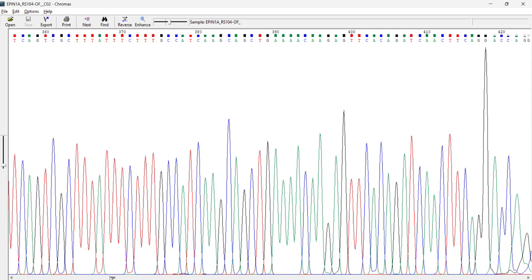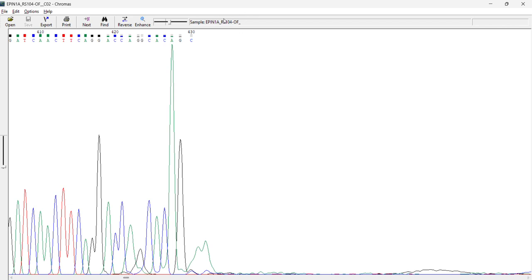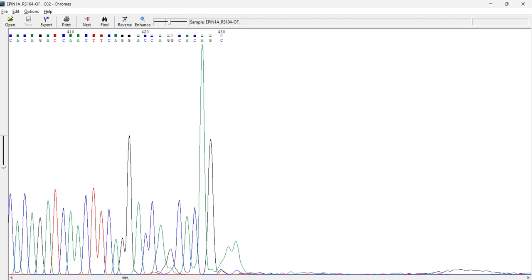As you can see this bar, I'll take it directly. Yeah, so it can read till 430, right? So the size of the read is 430, but you will see after that also there are some colorful lines. Basically this is the noise, the dye that is added to the sequencer. Because of that the machine reads some signals and you can see this. You just need to ignore this.